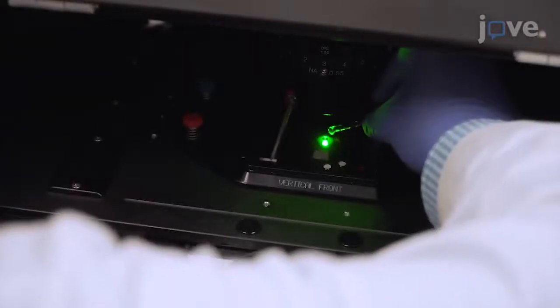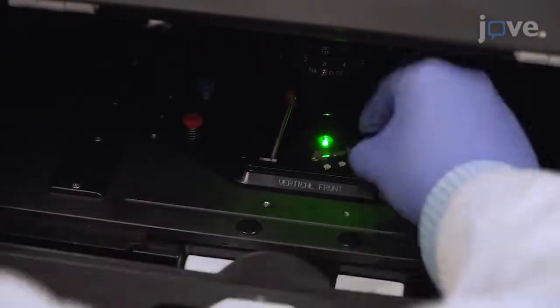Place a drop of 1.517 refractive index oil into the 100x oil immersion objective and transfer the glass bottom dish containing the sample.